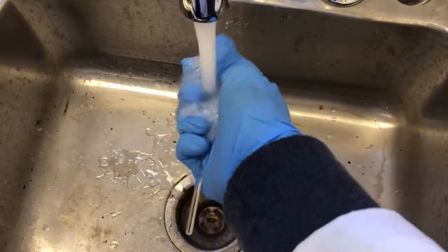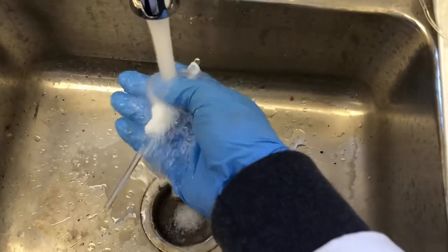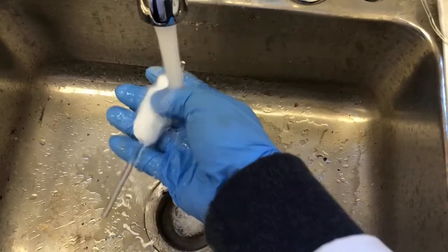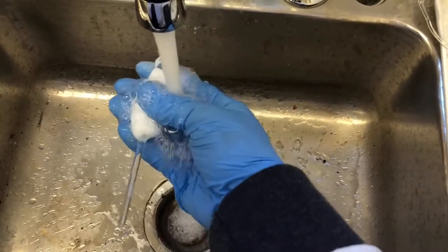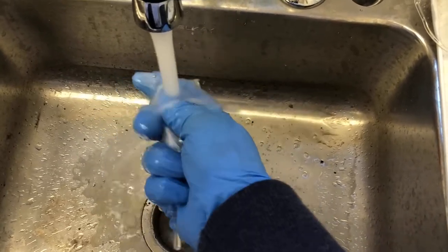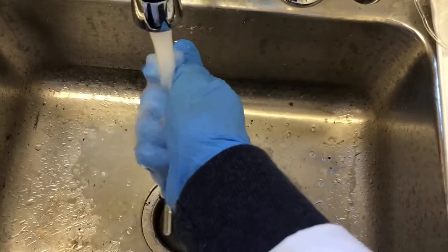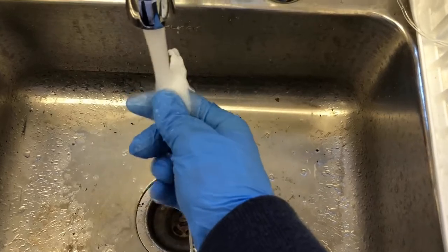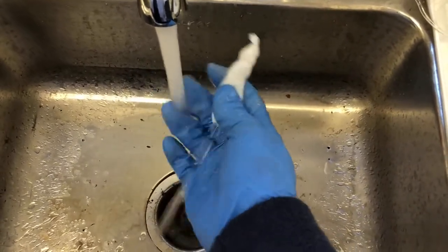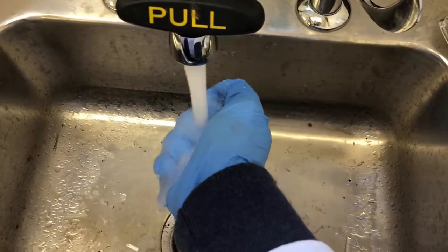This is very low concentrations, so you don't have to worry about washing the sink. I just want to squeeze this guy, wash it off. Squeeze, squeeze, squeeze. I'm going to go ahead and take off now at this point. We'll clean up. I'm not going to show you the cleanup for the rest of it, but I think you got the point.